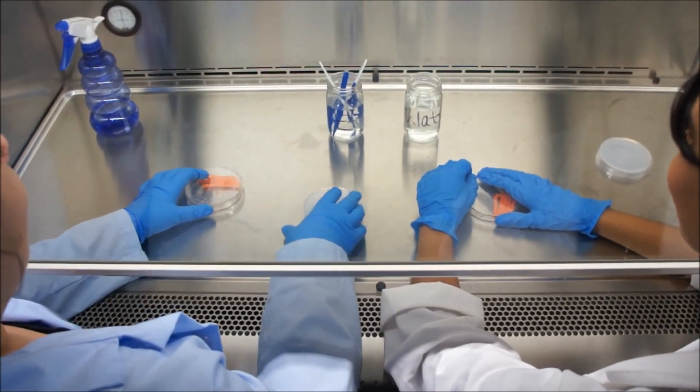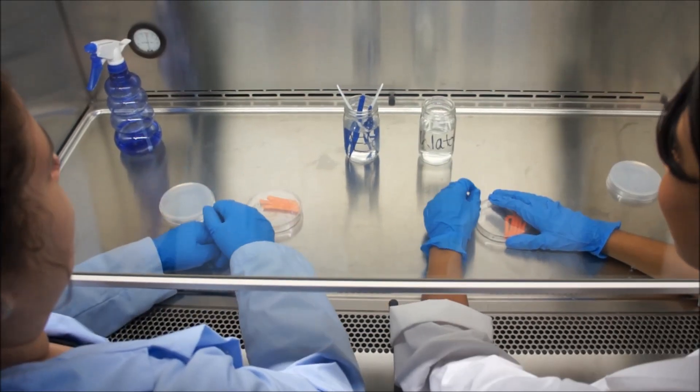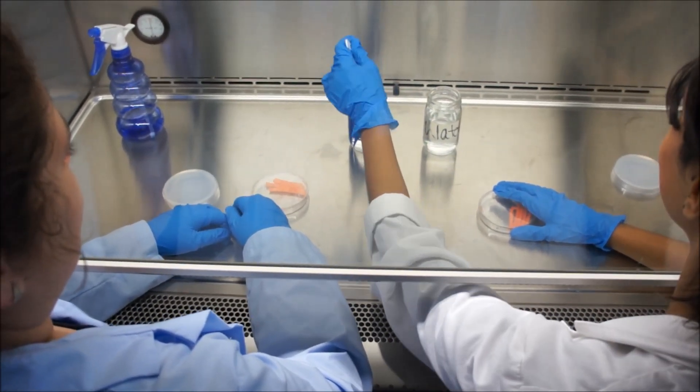Put forceps and scalpel in ethanol for at least 20 seconds and then shake in sterile water to wash off the ethanol.